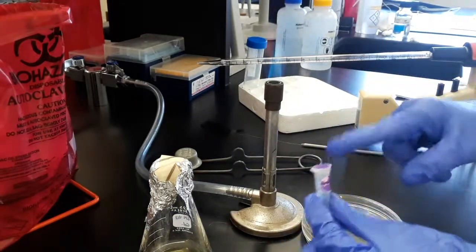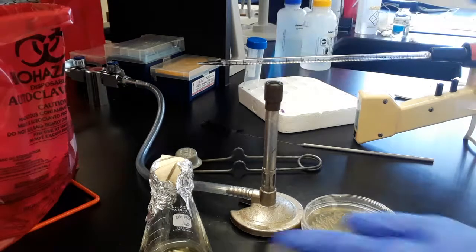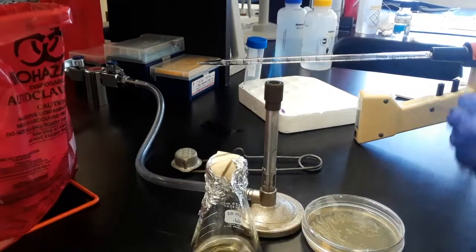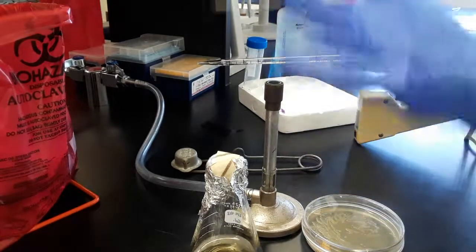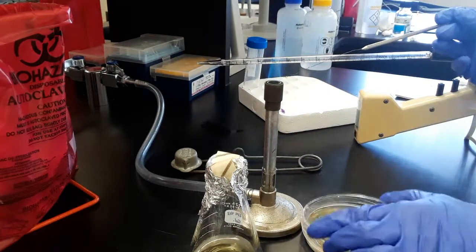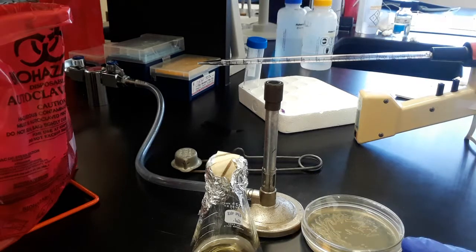There's ampicillin from a stock solution already in this LB broth. We work around a flame. That way you have an upward convection and you can open up containers and actually keep them sterile.